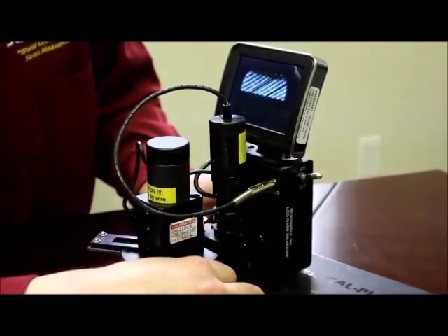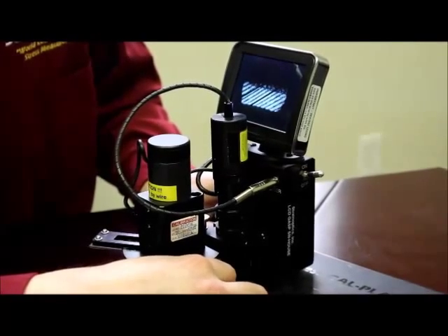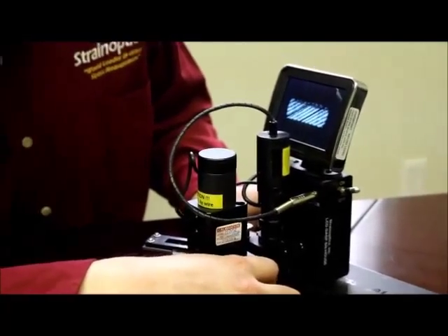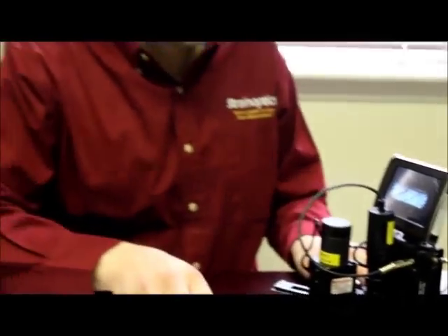Once you've chosen the correct locations for these four different elements, you should have a high quality image that is easily measurable. That is the correct way to operate the GASP instrument. Thank you very much for watching.